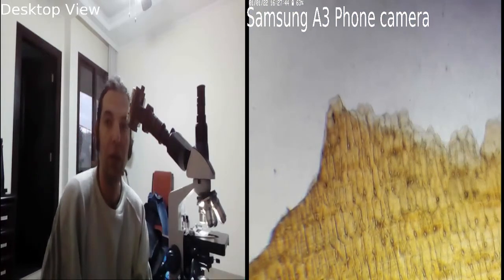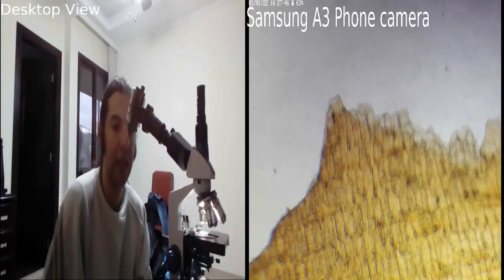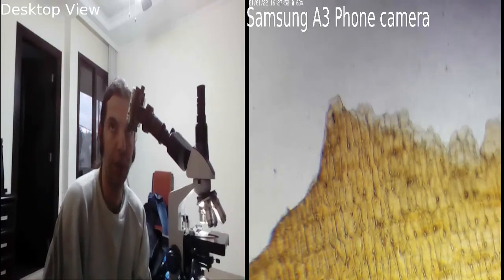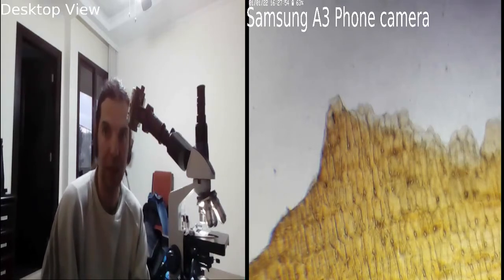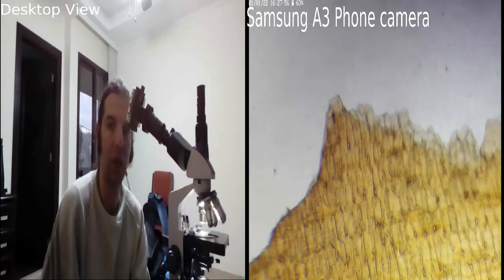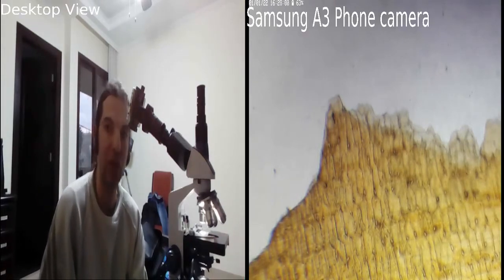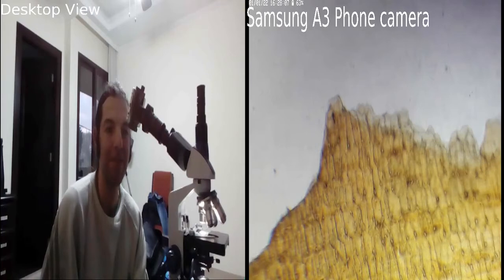Just for your information, the shortest focal length you can really use with something you can understand using your own eyes is 4 millimeters on a telescope. On a microscope, you can use less than 4 millimeters, but you can't really understand it; things will be very vague.